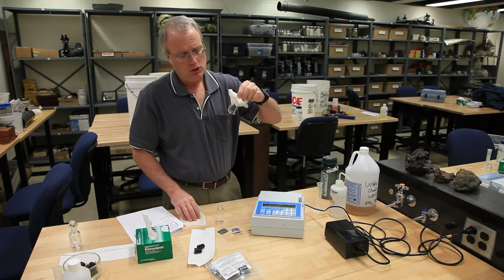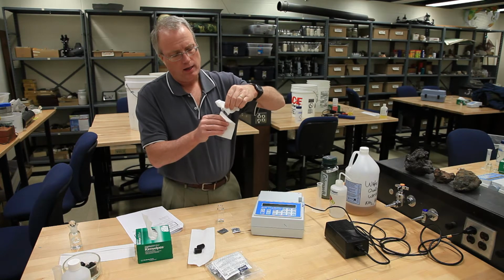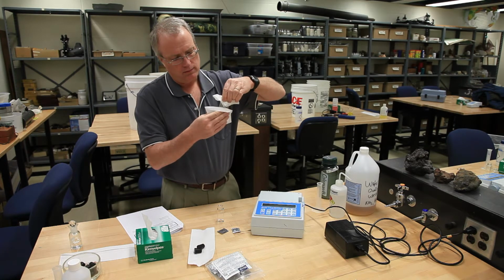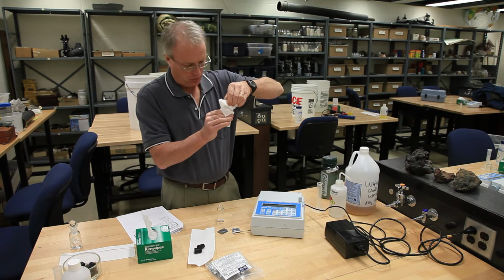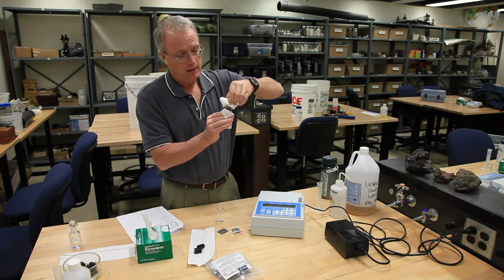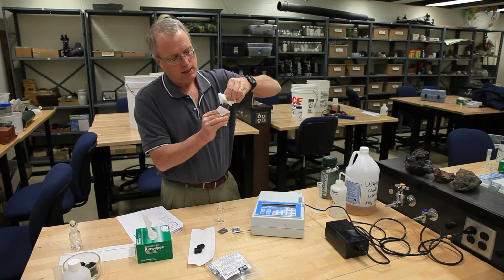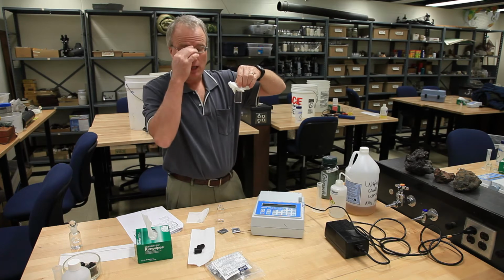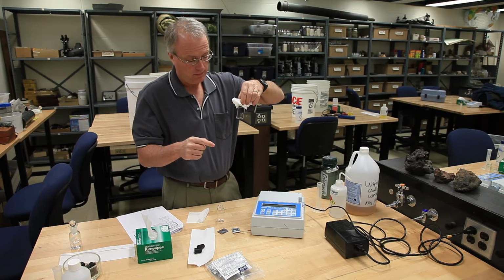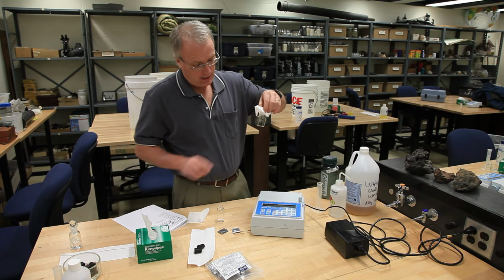Before it goes into the machine, this needs to be well cleaned. So I'm picking up by the top with a Kim wipe, and I'm really going to scrub it. And you can do this during the waiting periods. For both tests, there are waiting periods where you have a timer going, 2 to 5 minutes depending on the test. And so you can use that time to really clean these well. They need to be absolutely clear, free of defects, because you're going to beam light through these as part of the measurement.